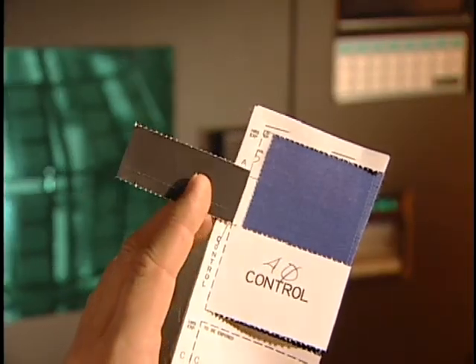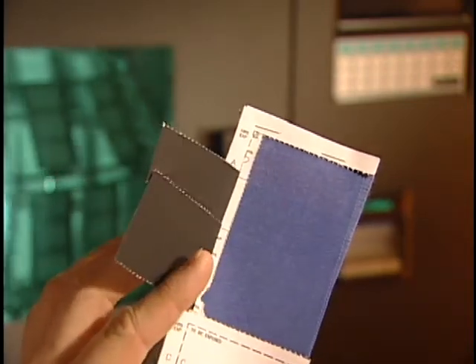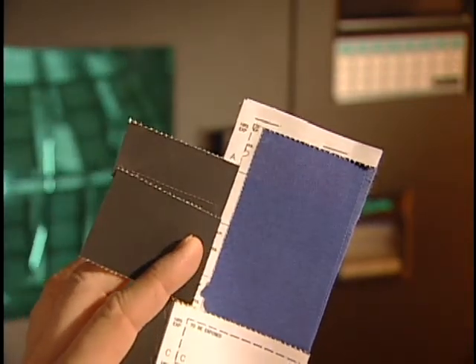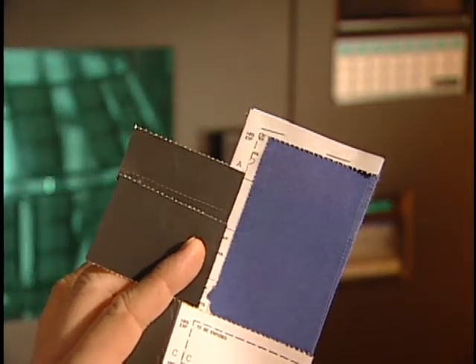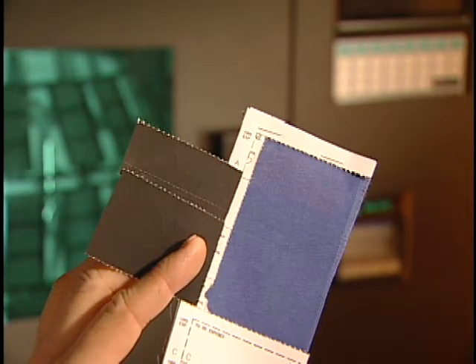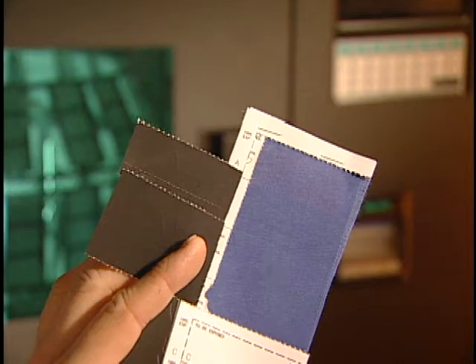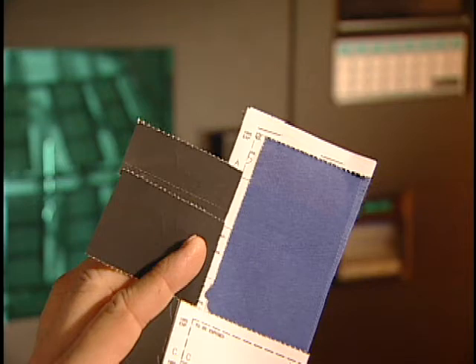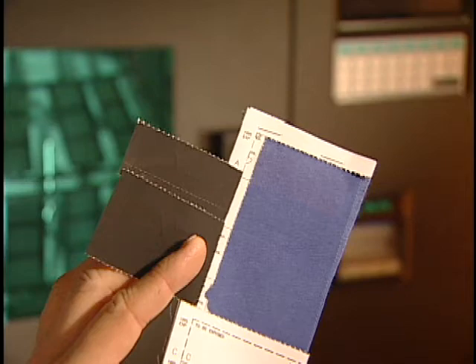In addition, the options vary in the conditions of exposure to the light, such as continuous or in cycles, light to dark, chamber temperatures, relative humidity as related to light or dark cycling, the type of filter, and other aspects. The light source used in the test is normally either a carbon arc light source or the more popular xenon light source, depending on the equipment that's available.